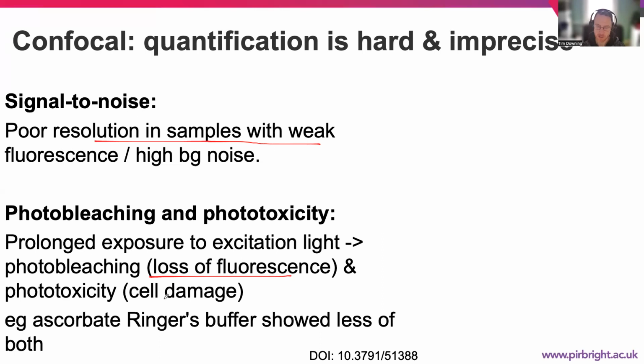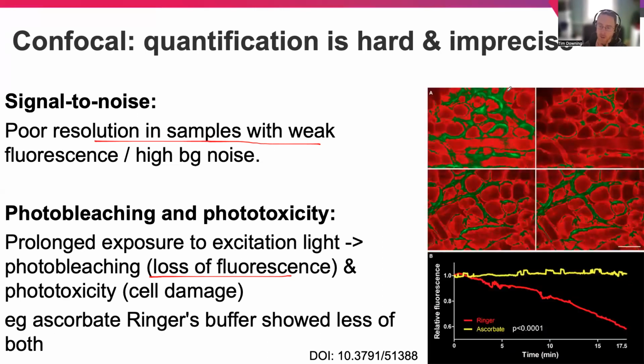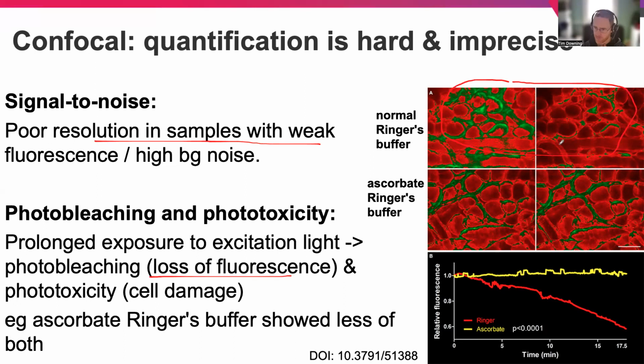An example of this is the optimal buffer, which in this case was ascorbate Ringer's buffer, which showed less of both. So we see here on top images where we have the normal buffer where we get this photo bleaching and phototoxicity over time, whereas on the bottom we get a better buffer which shows more consistency over time. You can see that graphically the relative fluorescence is the same for the lower panel, whereas for the upper panel it declines over time. And this might give false positive inferences.